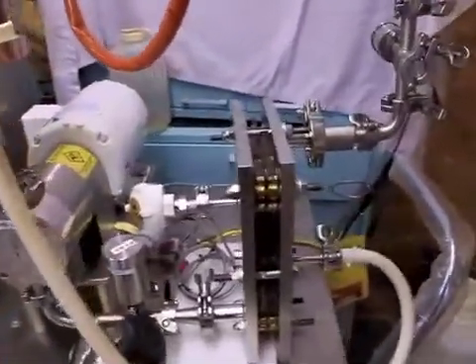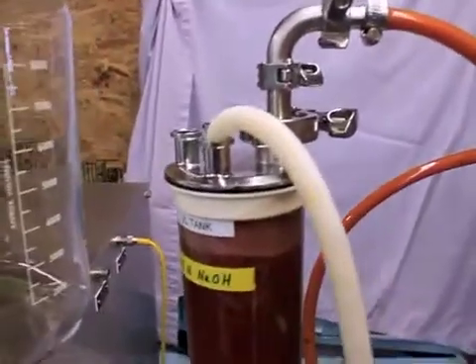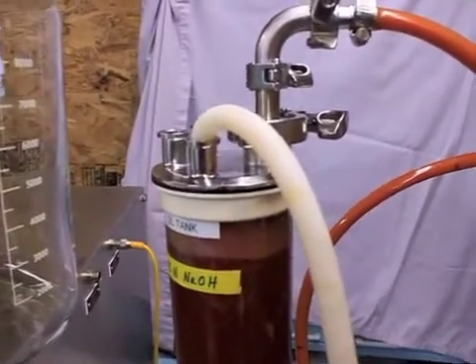In order to do that we need to remove the permeate and come out of the permeate port. Follow the white tube — just for now we're recirculating back to the tank, but as we're doing the processing we'll be moving that back into this permeate catch tank.